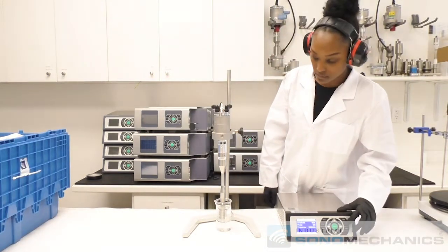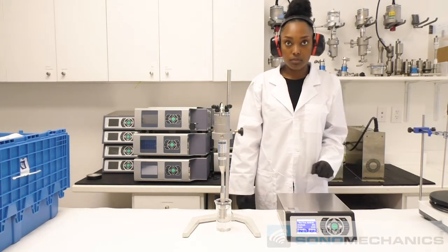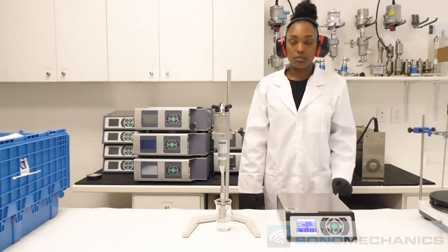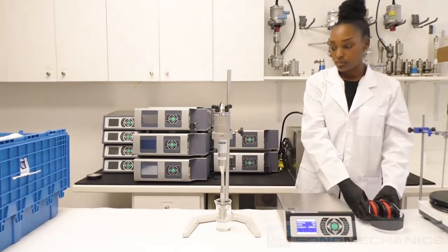In order to quickly test the assembled processor, activate the ultrasonic output by pressing the start button — see user manual for details. Deactivate the ultrasonic output by pressing the stop button. All done!